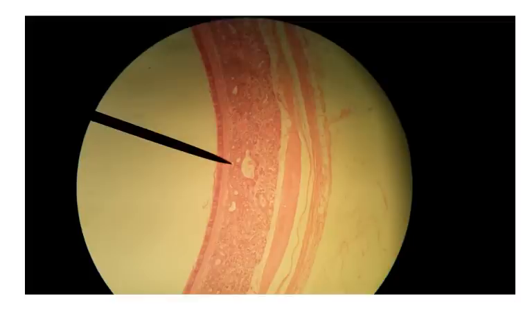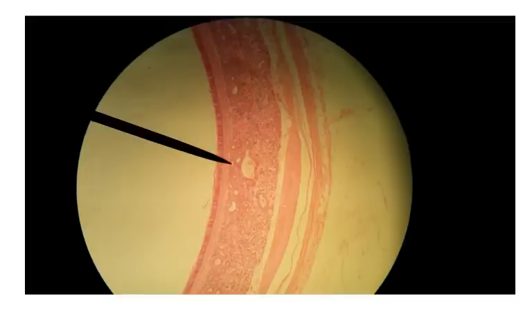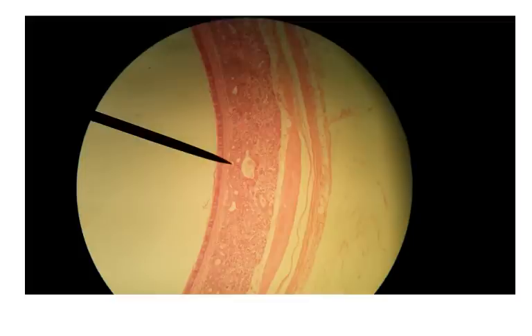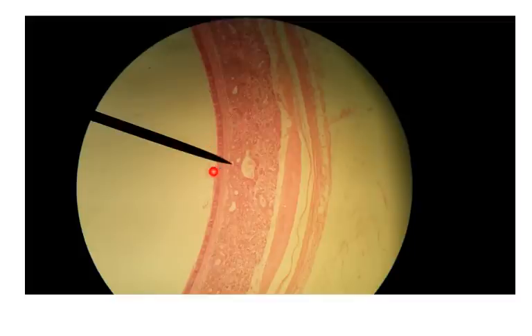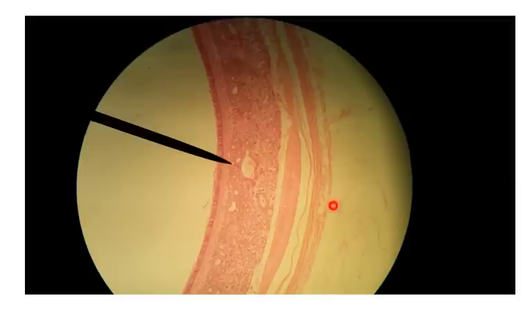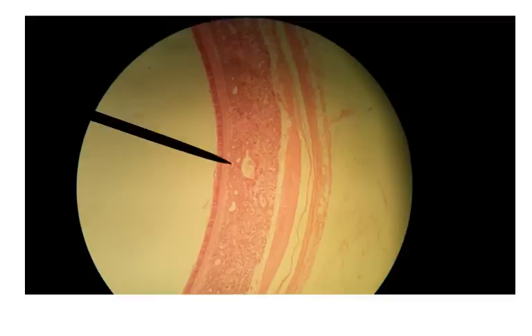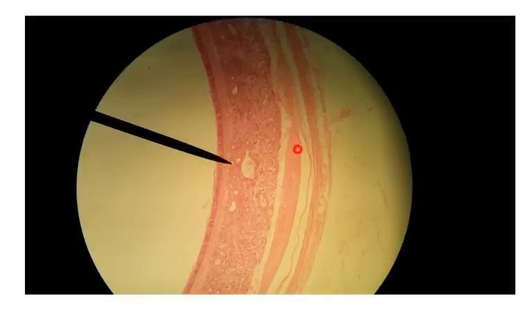Let's start with respiratory. This slide is showing a slightly magnified view of the trachea. This area here is towards the inside of the trachea, and this side is the outside. In this view you can see a couple of different things you'll need to identify.